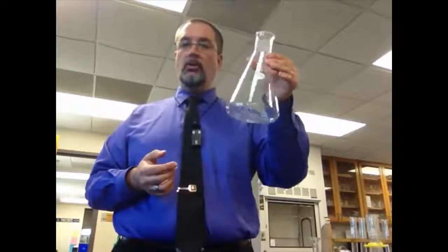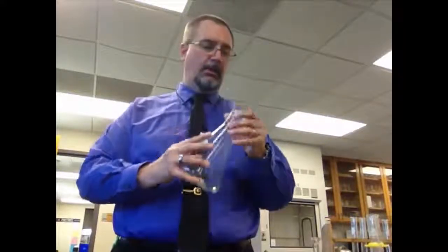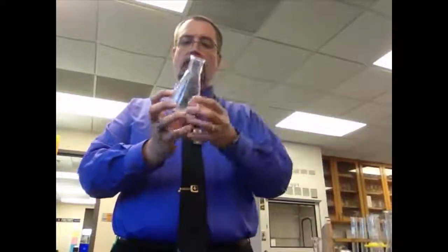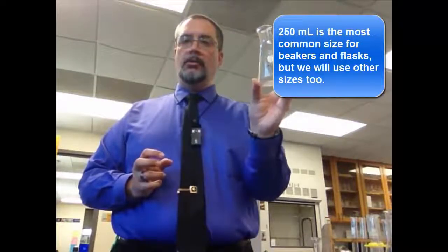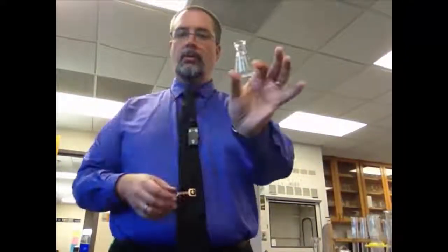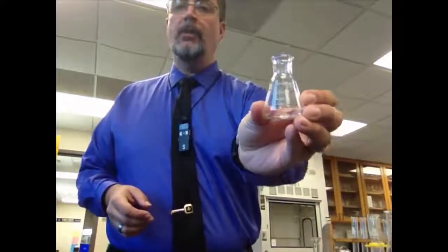So we often do chemical reactions in flasks, because if there's any kind of splashing, it'll usually be contained by the sides. This is probably the most common size. This is a 250 milliliter Erlenmeyer flask. You'll be using these every now and then. And again, they get very large or they get very small. This is a 25 milliliter Erlenmeyer flask, but you see it's the same shape, the same general size. Some of these may have numbers on them, but we don't really measure anything other than approximate amounts in an Erlenmeyer flask. If you want to measure volume, you need to use something called a graduated cylinder.